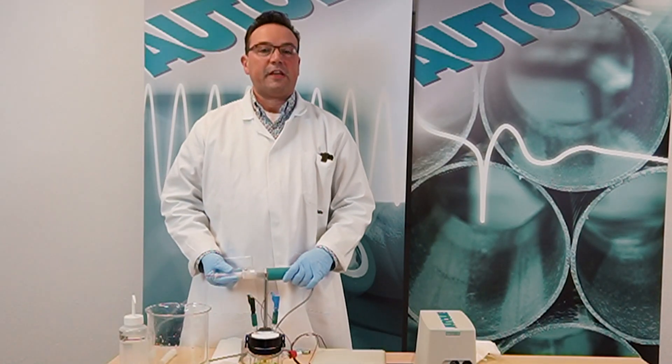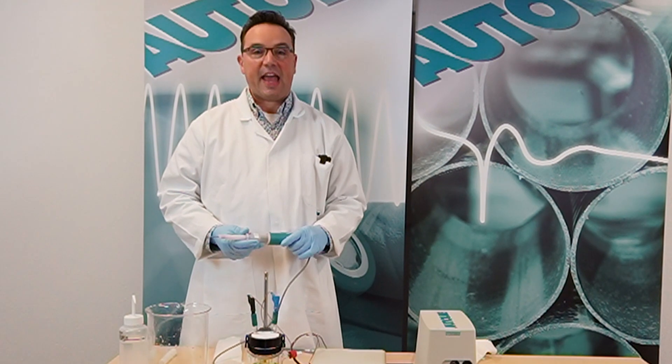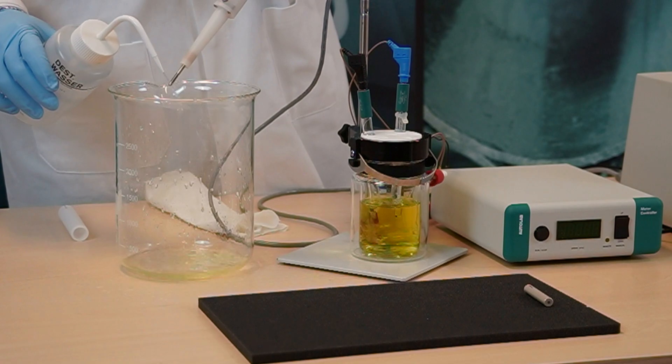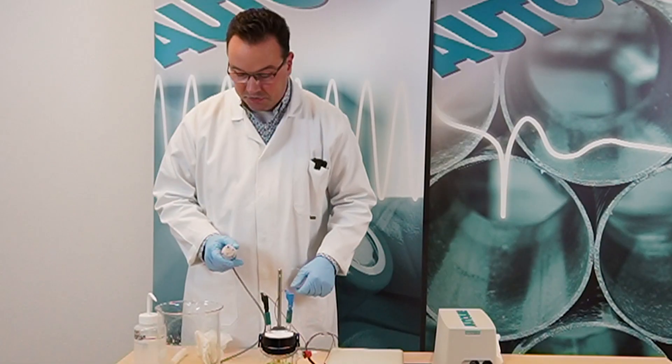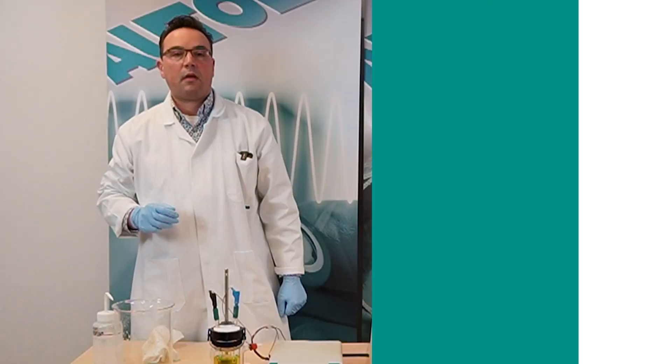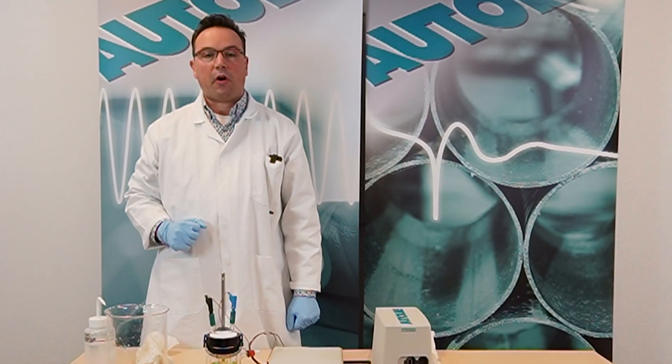Do not store the RDE 2 with the electrode tip attached. Always rinse the axle of the RDE 2 with demineralized water and dry the axle with paper towel. Cover the axle with the protective shaft. Please refer to the user manual for more detailed information about how to clean and store your RDE.